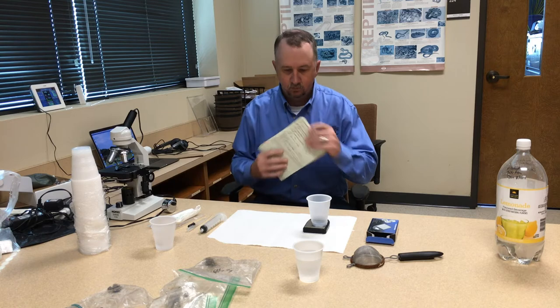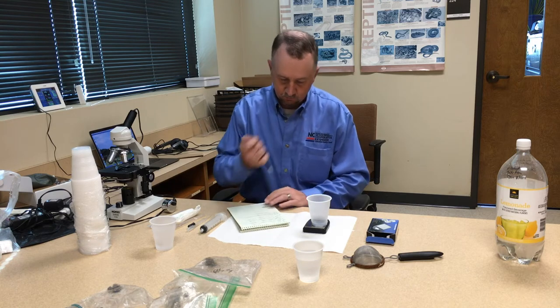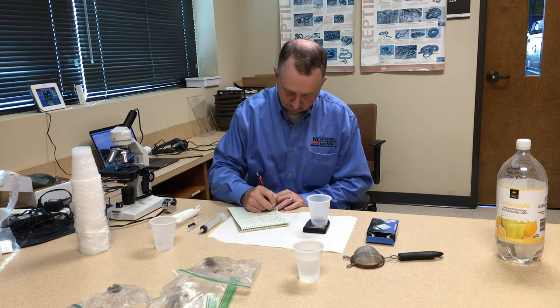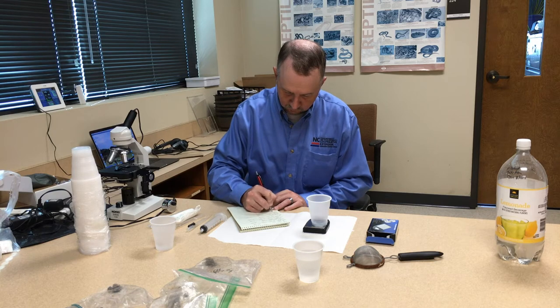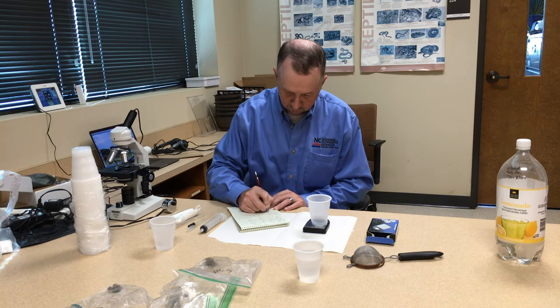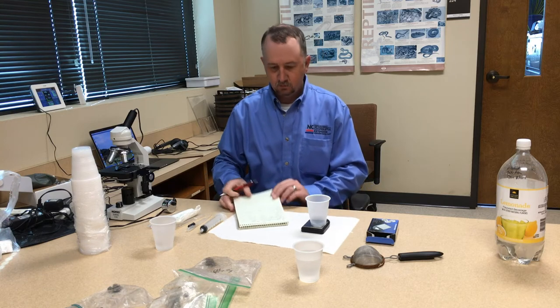Once you've weighed out your sample, record the weight to the nearest tenth of a gram. You'll divide this number into 100 and use that result as a multiplication factor for the total number of worm eggs you find.